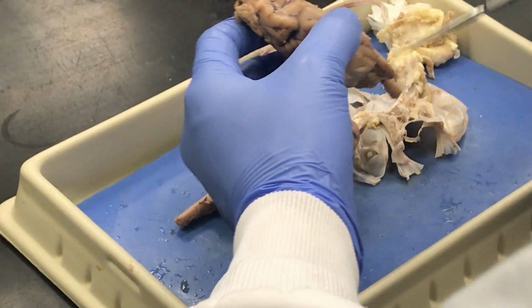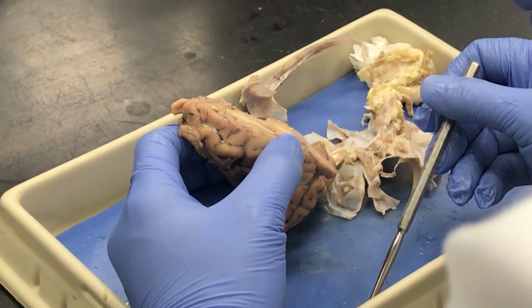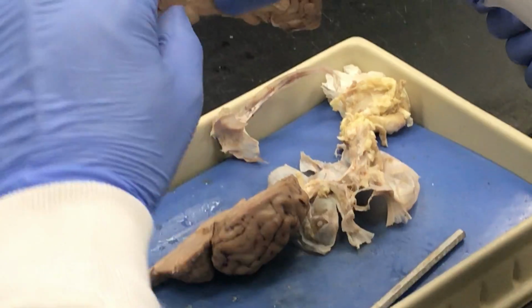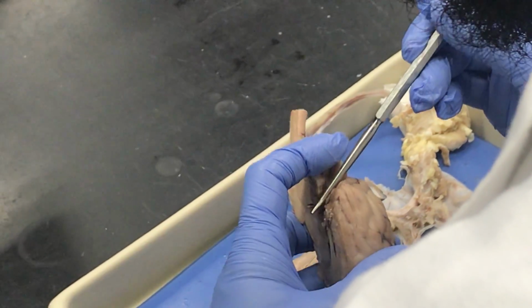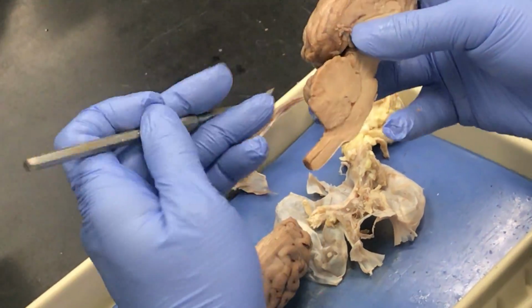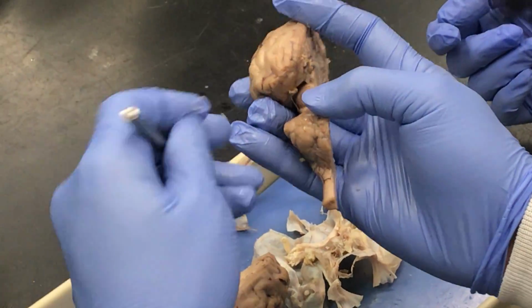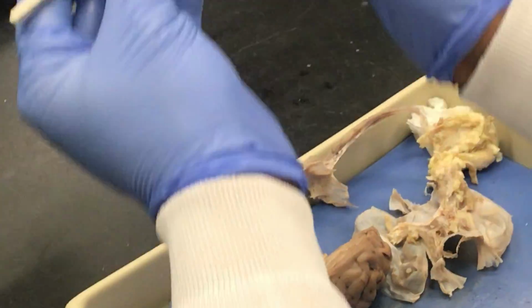Mesencephalon. Mesencephalon, again, is the midbrain. Just look for that cerebral aqueduct, that little channel right in this area. With the corpora quadrigemina. Sorry, quadrigemina, rolls off the tongue. All you have to do is take the cerebellum and pull it down slightly. Now, of course, it's already been sliced in half, so we're not going to see the four bulges. We'll just see two to each side.